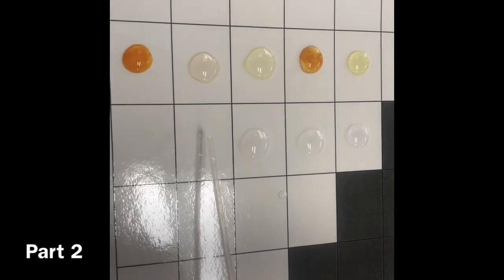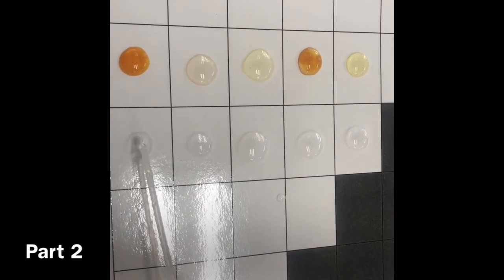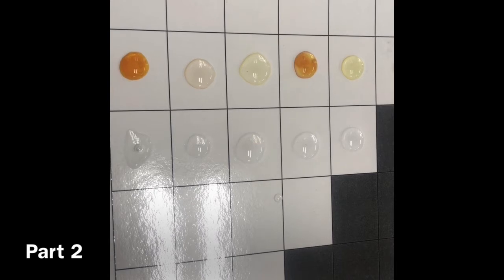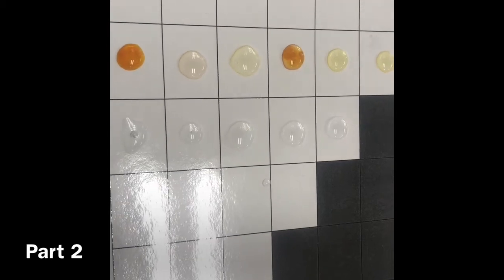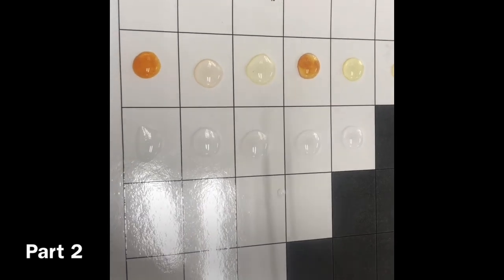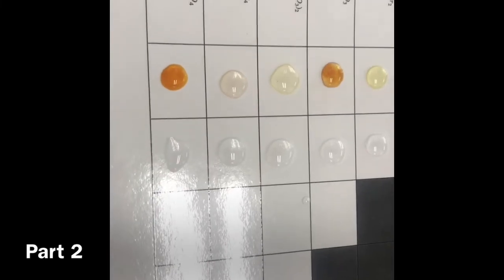It became really white and cloudy. I'm just gonna finish off both of these. Okay, and now NaS. Not sure if you guys can see that. None of these are gonna react. Alright, NaCr maybe?